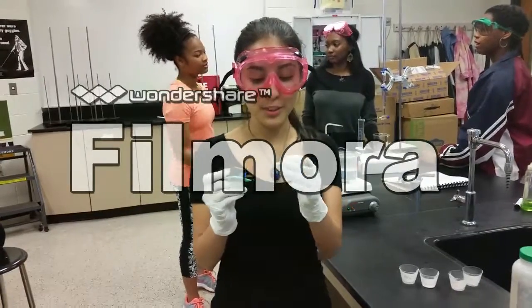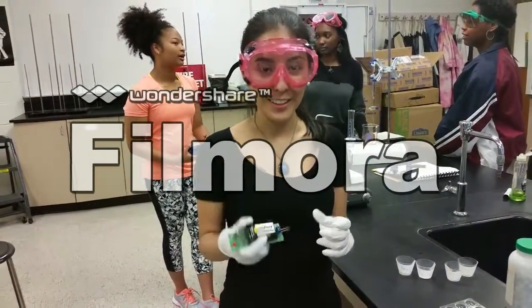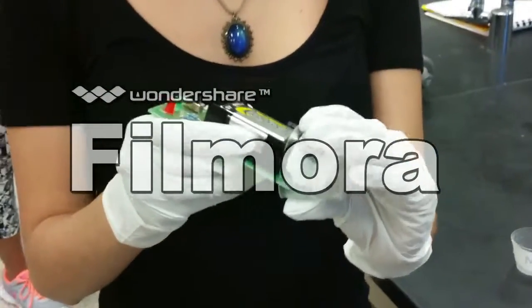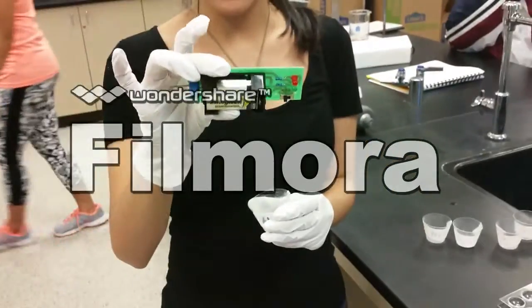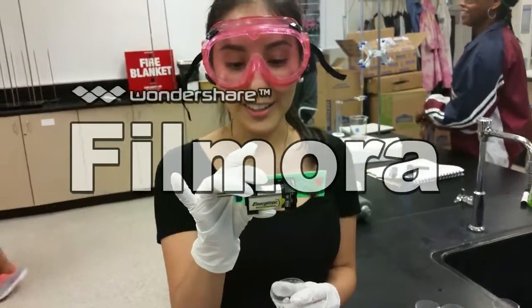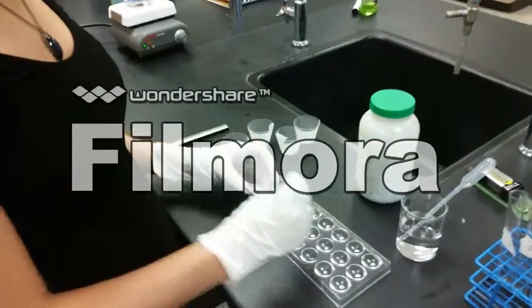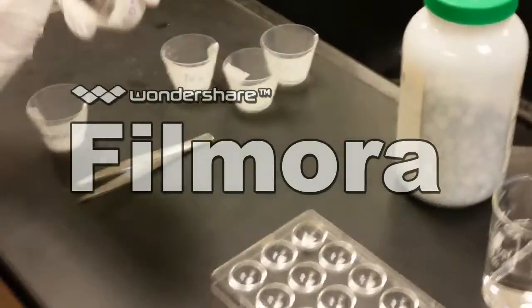Okay, the next thing we're doing is testing the conductivity of each solid using a conductivity tester. Very simple, you just turn it on and make sure to wipe off the tips of the conductivity tester, or else you may get inaccurate readings. So you're going to just want to touch the tips of the conductivity tester to the solid you are testing. For this we tested aluminum and we got a bright red light on and a dim green light, which meant that the aluminum had a high conductivity, and you're just going to want to go ahead and do this with every solid.